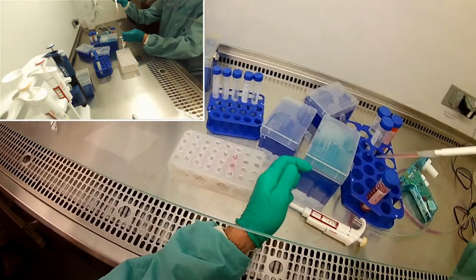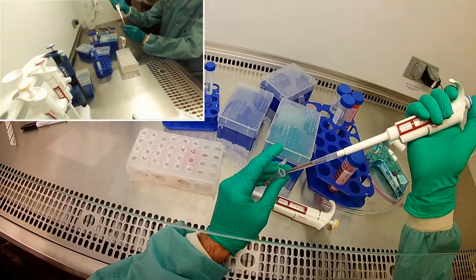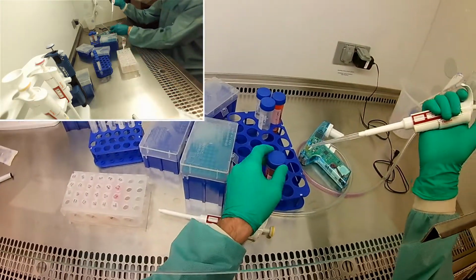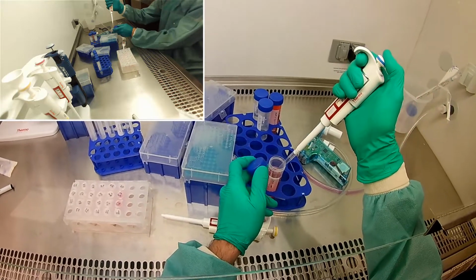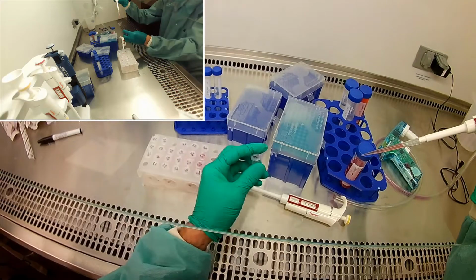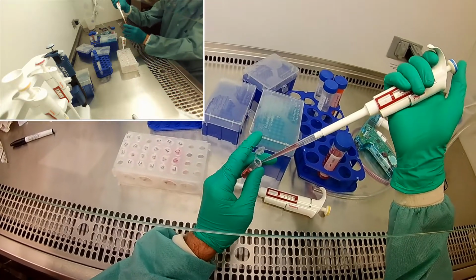And the reason I did 12% is because 0.5% antibiotics, you know, we're already close to that with the 0.2 control, and then 8 to 16 might be a little bit too big of a jump, so I just decided to do 12 instead of 16.